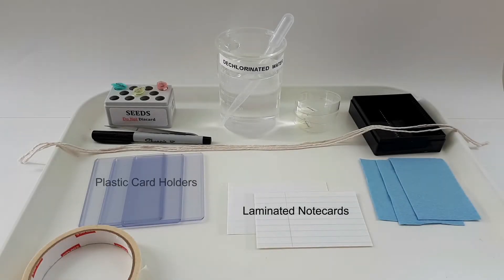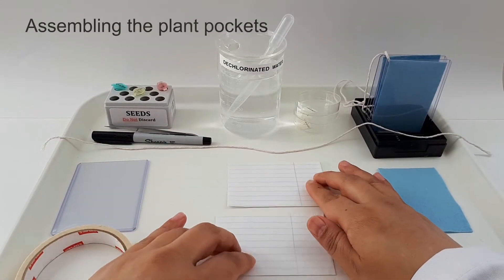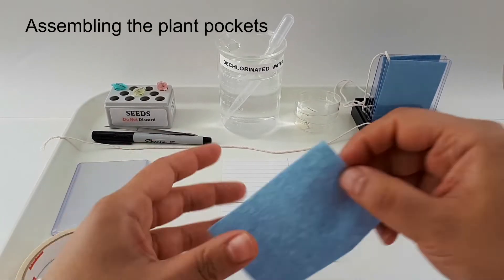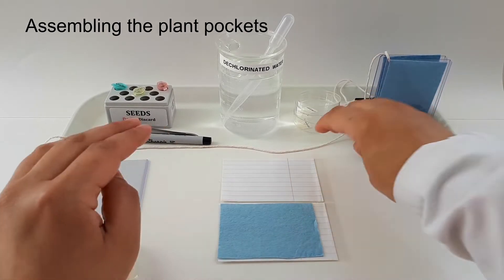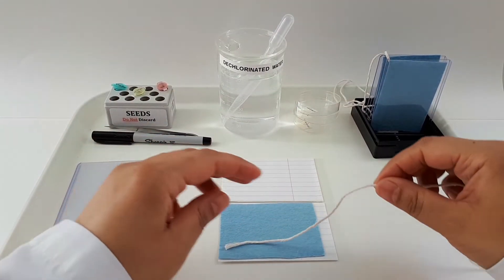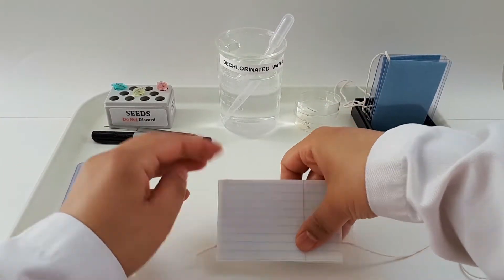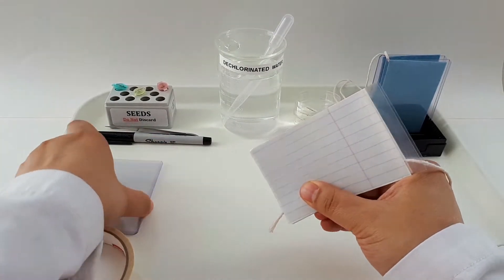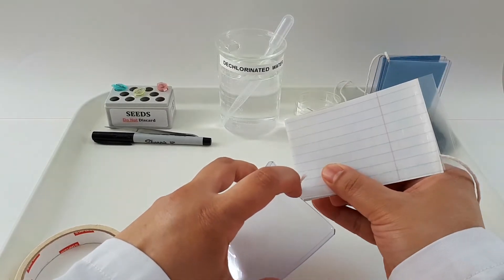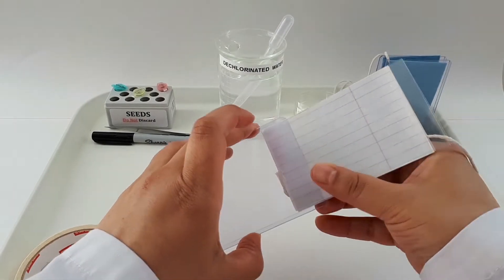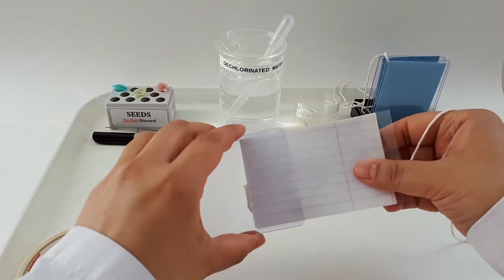Start by sandwiching one piece of shop towel and one end of the cotton string between the two pieces of laminated note card. Then insert the note card, shop towel, and string sandwich into the plastic card holder.